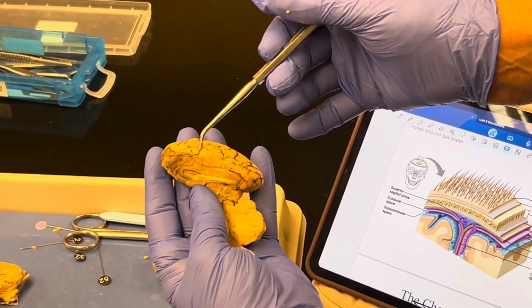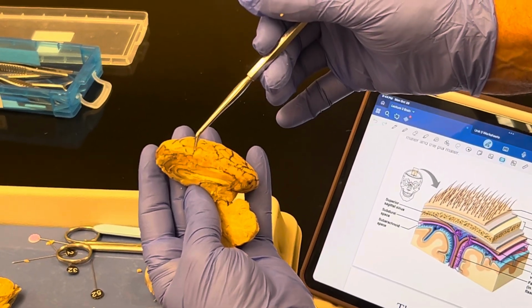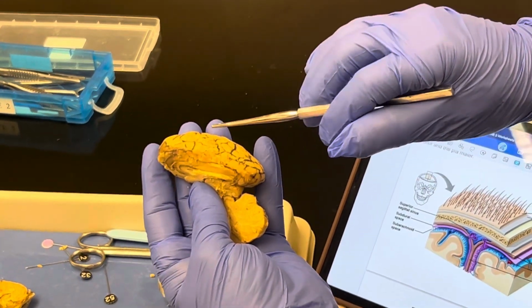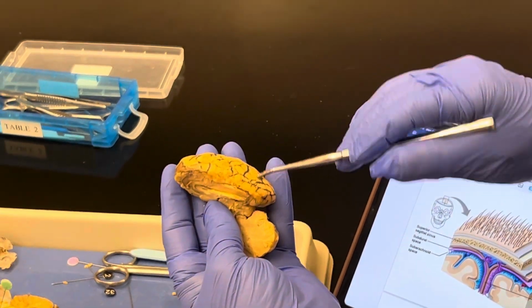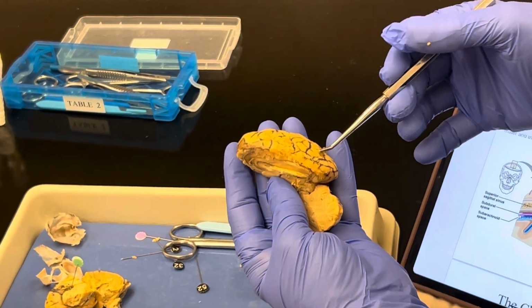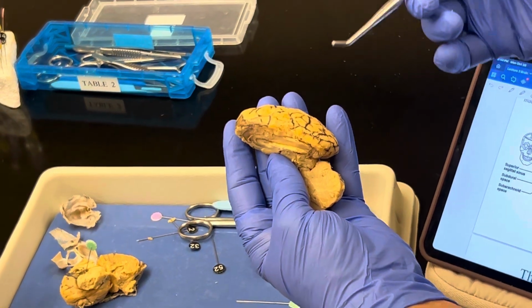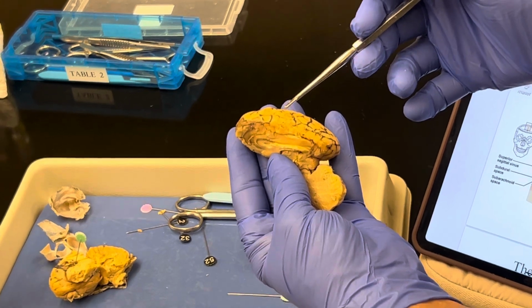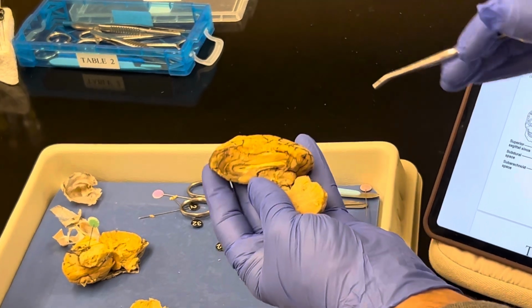We have these bumps here known as gyrus, and the valleys inside are known as sulcus. I said the first layer was the pia mater. Then we have the subarachnoid space where all of these vessels are actually located and floating in cerebrospinal fluid. Then we have a second layer known as the arachnoid mater, and then the outermost layer is the dura mater, which is made up of two separate membranes. The inner membrane is known as the meningeal layer of the dura mater, and the outer layer is known as the periosteal layer of the dura mater, and then you have bone that covers it on the outside.